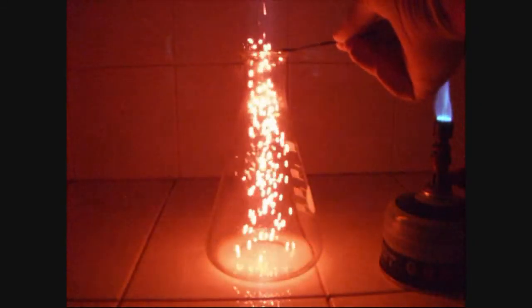The next experiment is the firefly experiment. For the best visibility, I'm using a 1-liter Erlenmeyer flask. First, I poured in some ammonia solution, which slowly gives off gaseous ammonia. The ammonia itself won't react with airborne oxygen, but in the presence of a catalyst — here I'm using the hot chromium oxide particles — a direct combustion of the ammonia takes place.